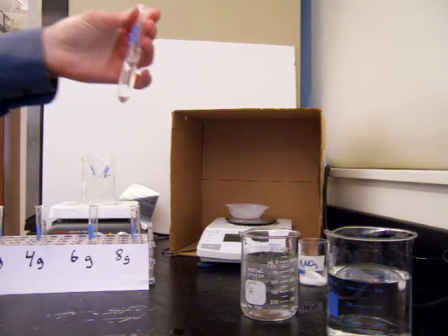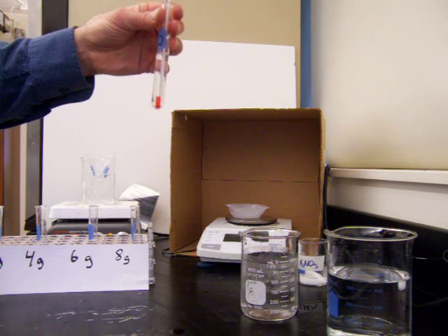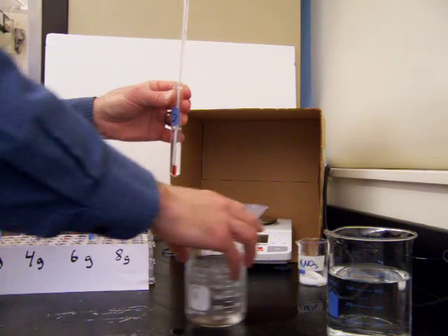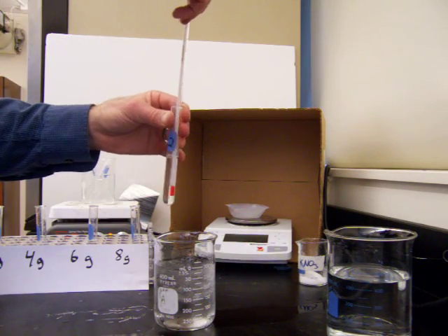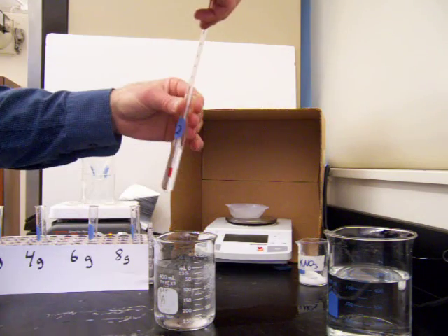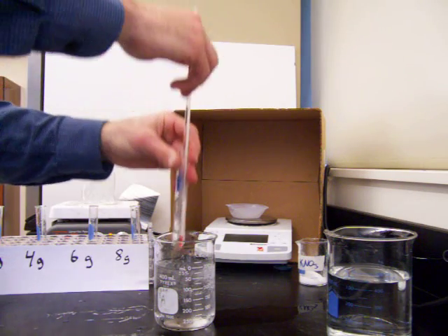What we're going to do now is stir this and let it cool and see at what temperature will the crystals come back out of solution. To speed this up a little bit, we can use a cold water bath. We have some ice here. We'll dip this in and stir it a bit, pull it out, and see if any salt crystals are forming. So far they have not.